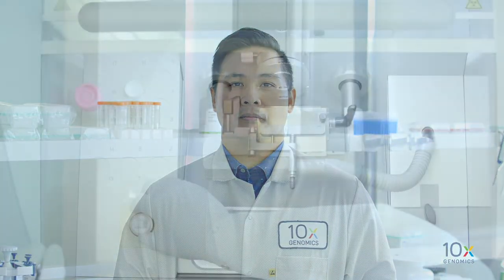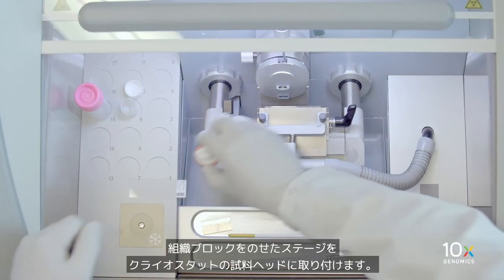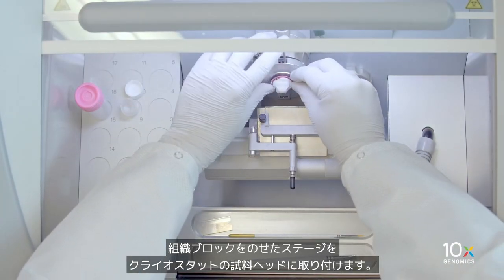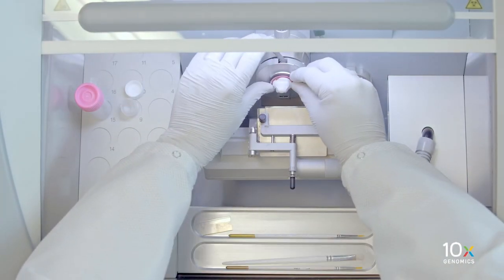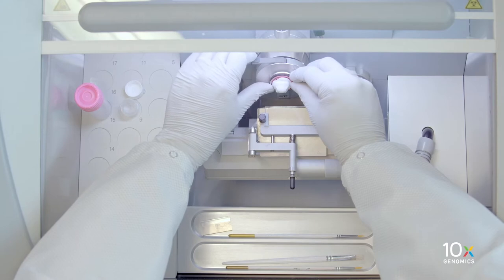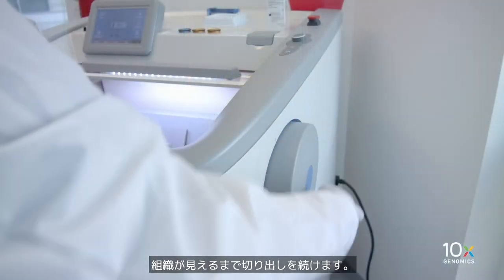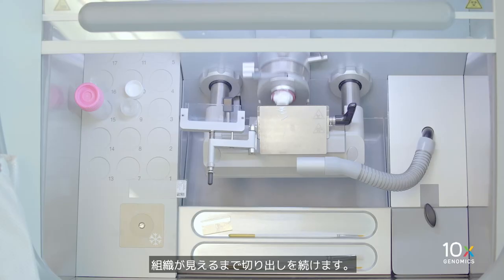We are ready to cryo-section our OCT-embedded tissue block. Install the stage with the tissue block onto the specimen head of the cryostat. First, we will remove the excess OCT and expose the tissue. Continue sectioning until the tissue is visible.